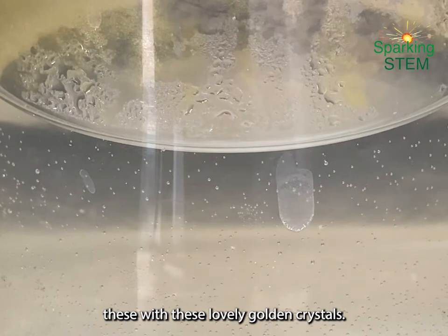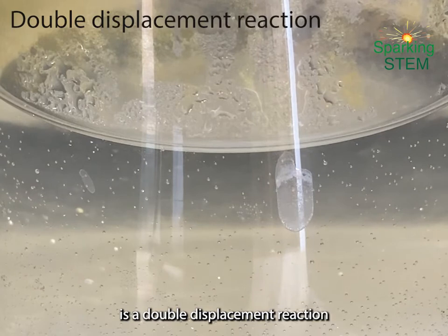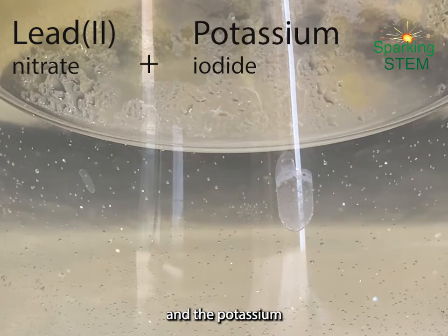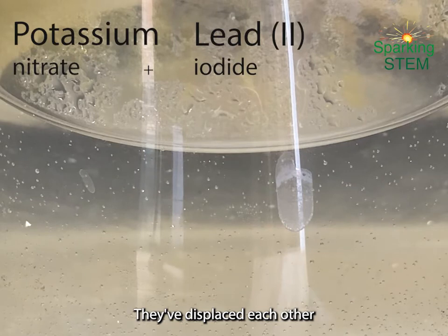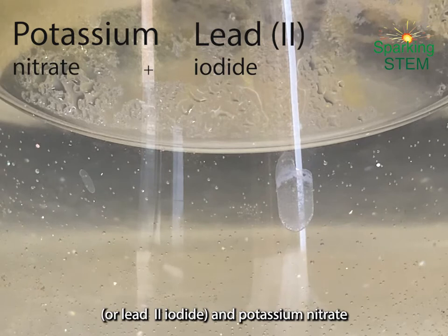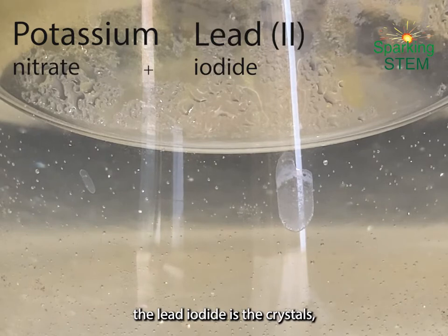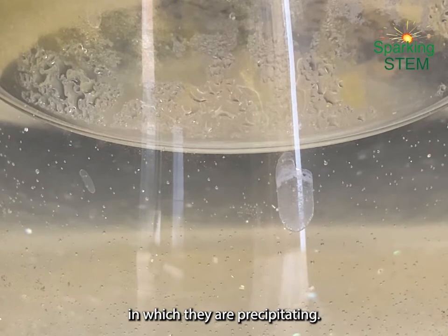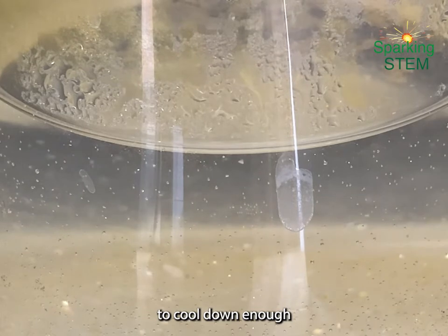Now, the other thing you can call this chemical reaction is a double displacement reaction, because what's happened is that the two metals, the lead and the potassium that were in our reactants, have basically swapped places. They've displaced each other and formed two new compounds, the lead iodide, or lead(II) iodide, and potassium nitrate. The lead iodide is the crystals, as we've mentioned, and the potassium nitrate is the solution in which they are precipitating.